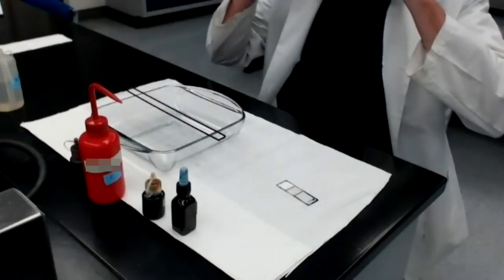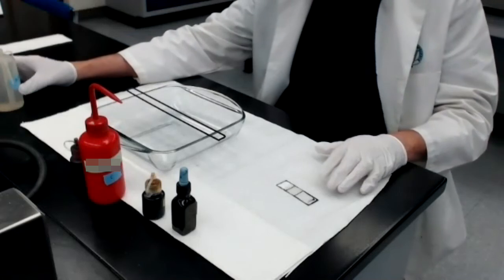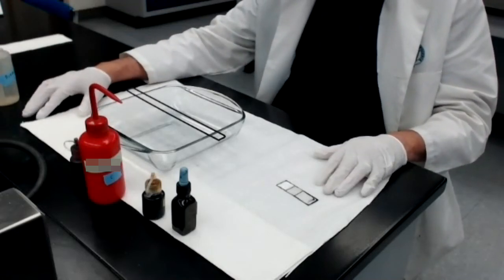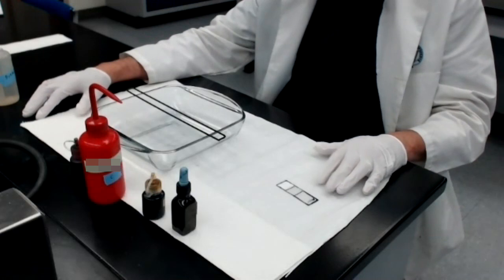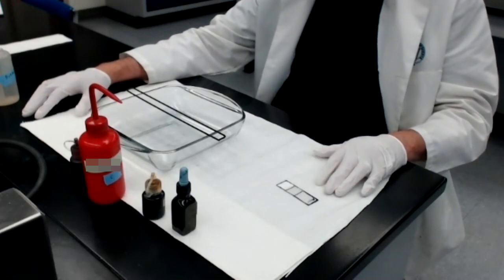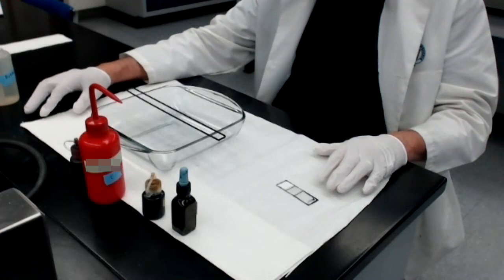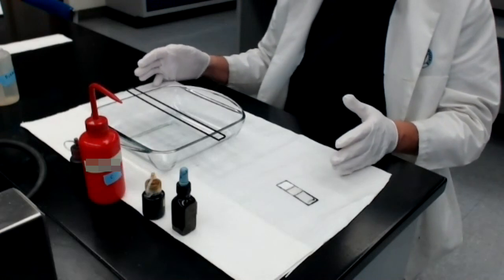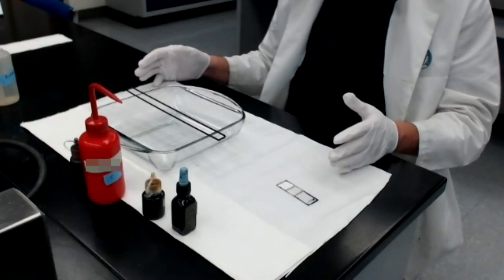So a little bit of background about the Gram stain. The first version of it was developed by a fellow whose name was Hans Gram in 1884. Numerous modifications were made to his original protocol between 1884 and probably 1910 or 1912.